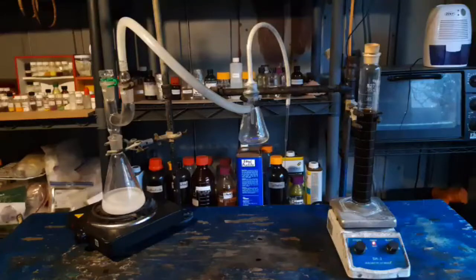Atomistry said it was flesh colored. Modern people would absolutely look at that and say yes, that is a flesh tone. I'm not sure what some European scientist writing about a century ago would have thought. Usually I'm looking for something more peachy than brown in that case. I hate it when they're so vague with their descriptions like that — flesh color could be a huge range of colors.